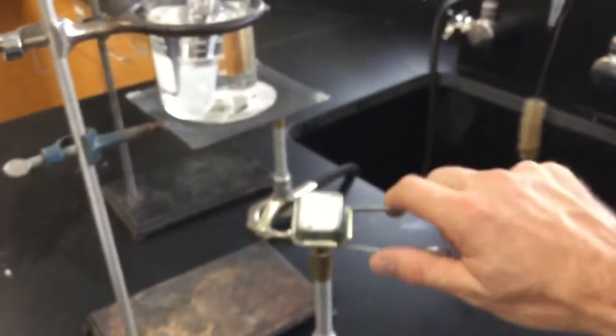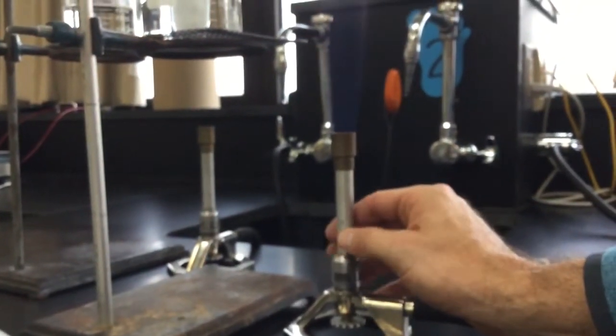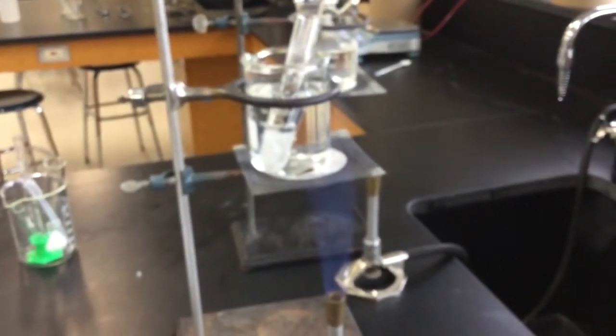Get the striker, catch the flame. If it's real high and yellow, open up the barrel to get more oxygen in the flame, then screw the bottom to get the flame lower — you can see that flame is way too high. Lower that bottom, then just put it underneath, heat that up, and stir until it's all gone.